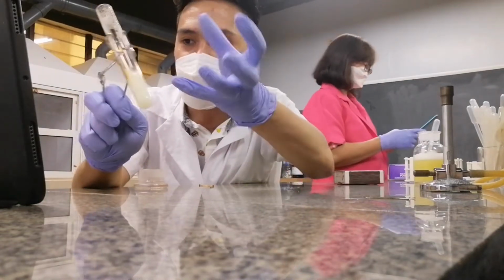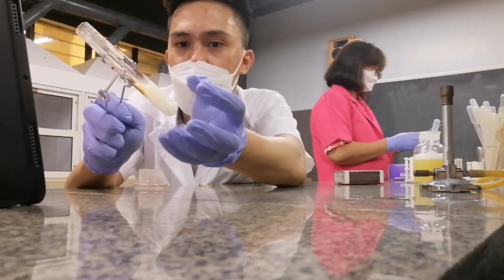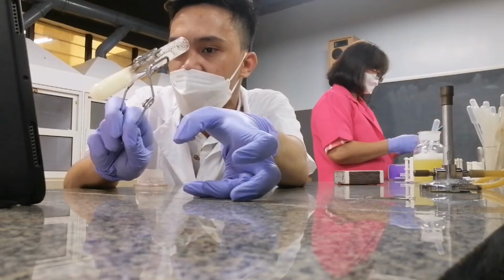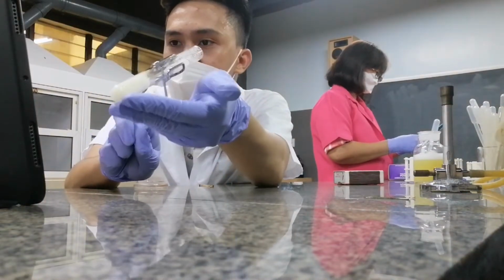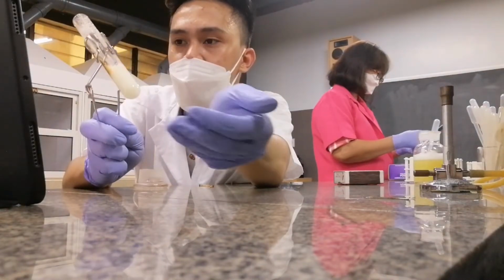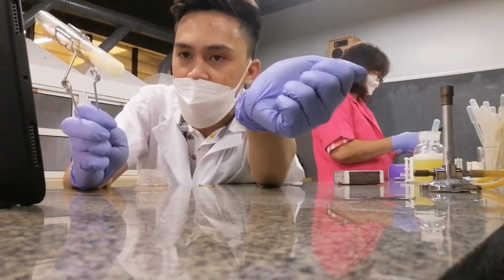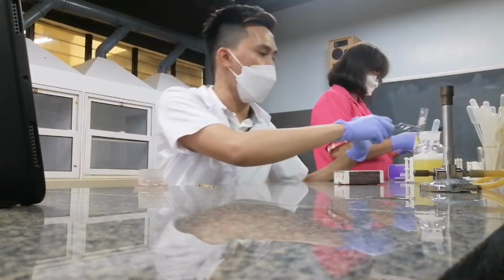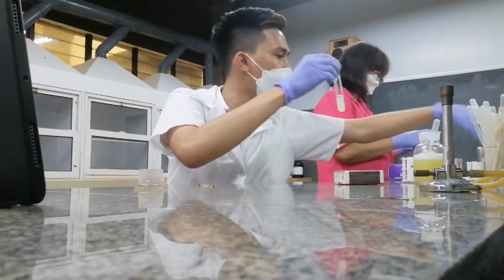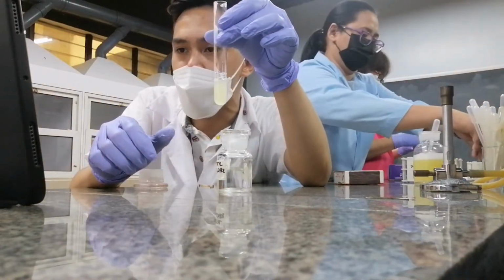What do we mean by coagulation? The solid will clump together to form a very, very clumpy substance. Do you follow? So the clump that we see is actually what we call your coagulum. Is that clear? Okay, so heating coagulates protein. Let's now try other factors. I still have here my egg albumin.